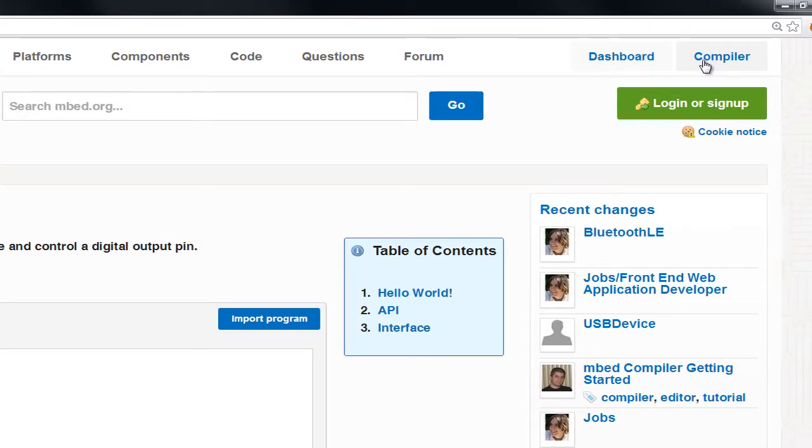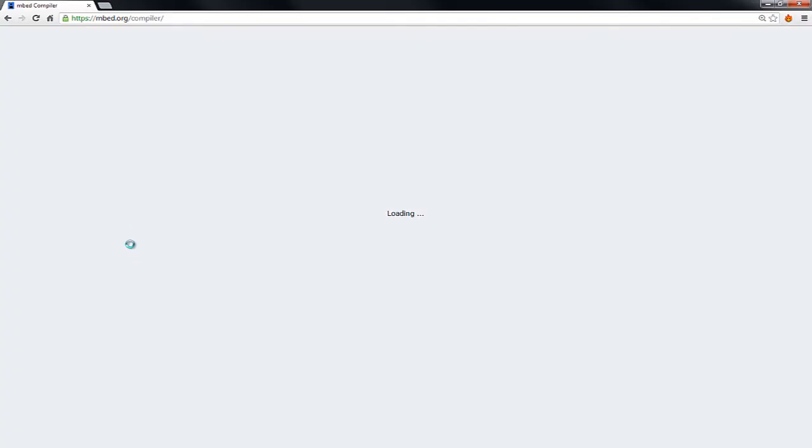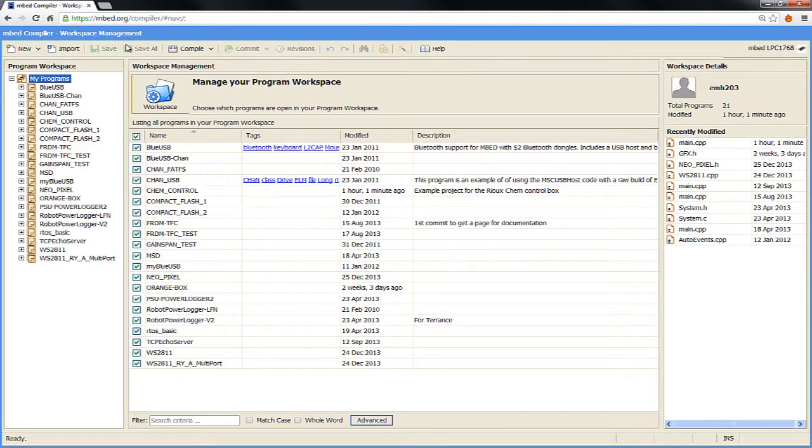So I'm going to click on compiler and type in my username and ID. This compiler works right in a web browser, so you don't have to install anything. For me, it brings up this interface, and I have a bunch of programs that I've done over the years while playing with the Mbed. First I'll show you how you create a new program, and then we'll see how we import the ChemBox program that I've published.